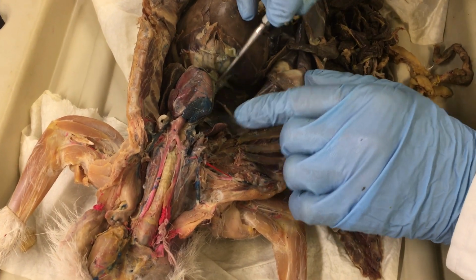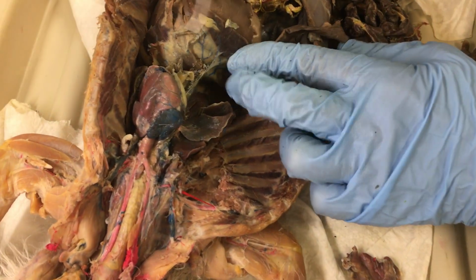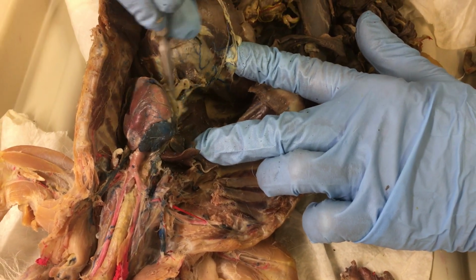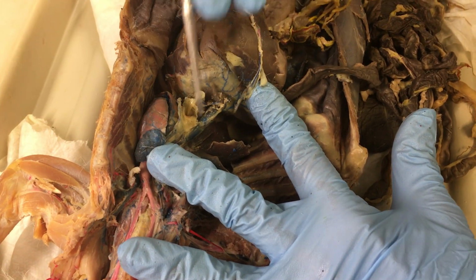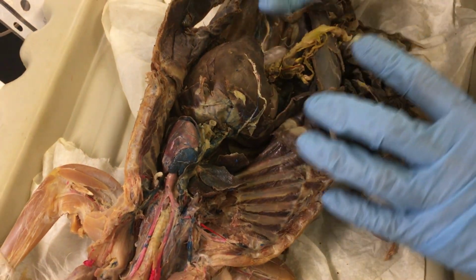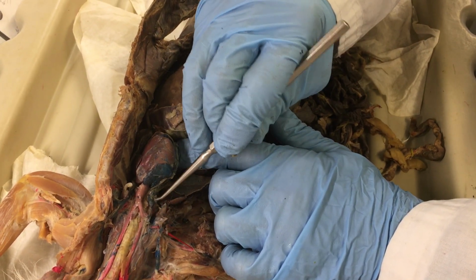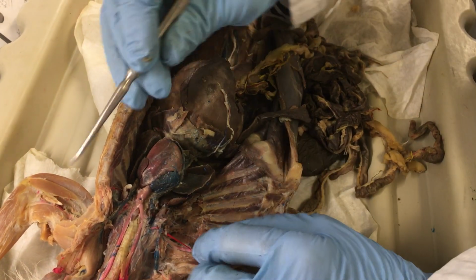I am going to show you also the caudal vena cava. If I move the diaphragm and the heart and the lungs, I'm pointing out here, let me get some of the fat away. See these big blue vessels here? This is the caudal vena cava, if you see it up here, right? That brings all the deoxygenated blood from the gastric area. And that one also will dump the blood into the right atrium, along with the one from the cranial vena cava, to go into the heart.